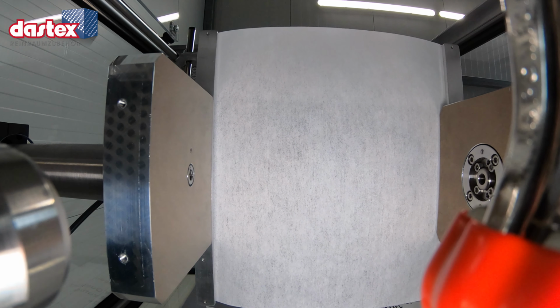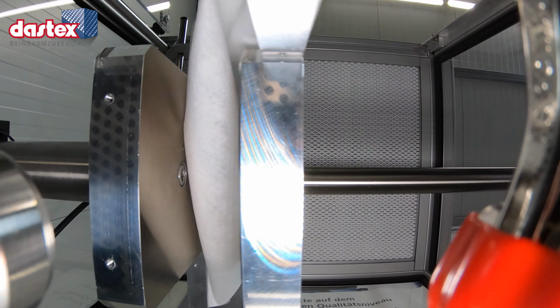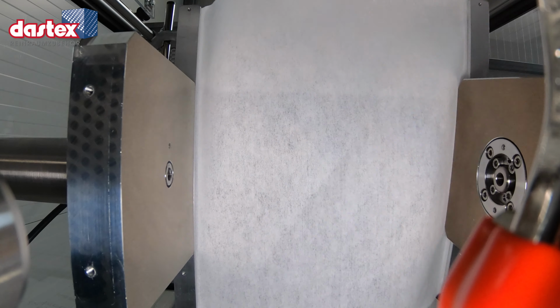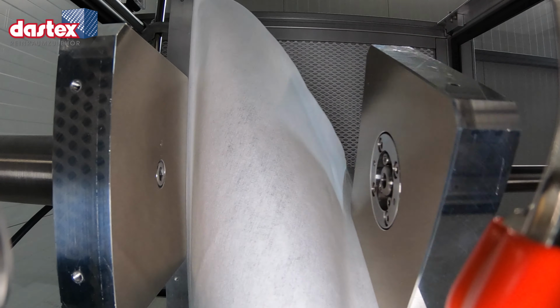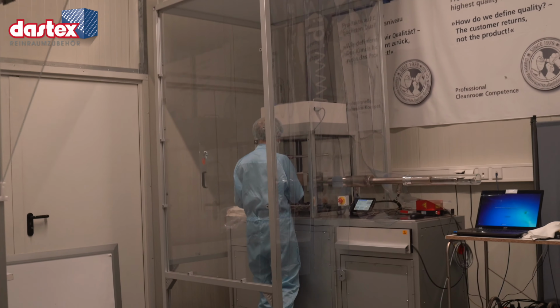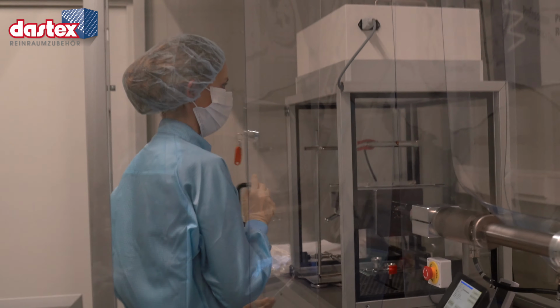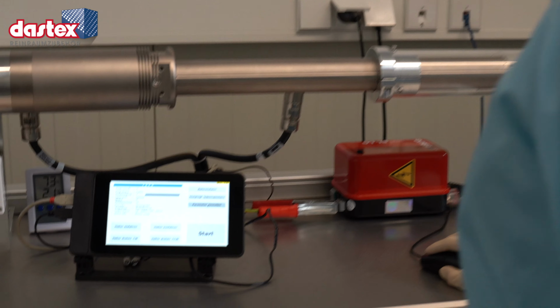First, the test specimen is clamped flat within the test device under controlled cleanroom conditions. A fan filter unit, FFU, is permanently installed above the wiper when it is clamped in the test device, providing vertical unidirectional airflow within the test enclosure. The test specimen is loaded and clamped within this test enclosure, which itself is housed in a mobile cleanroom. The persons carrying out the testing wear appropriate cleanroom clothing to minimize cross-contamination.